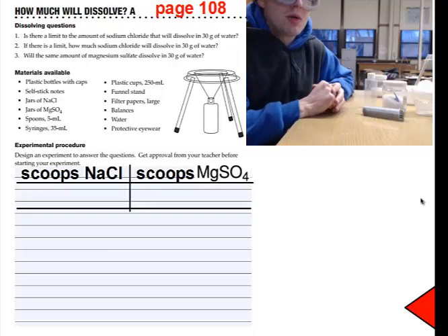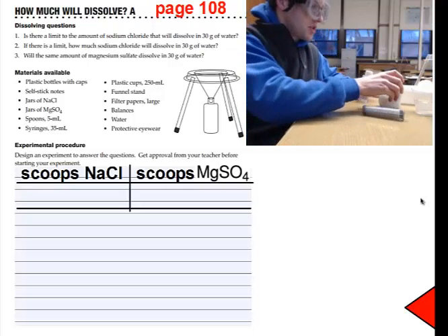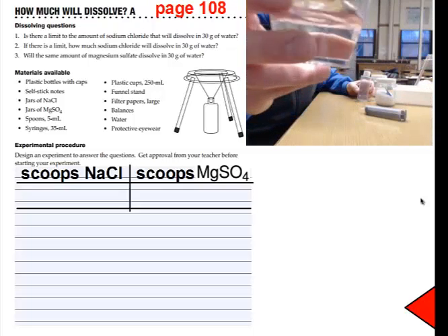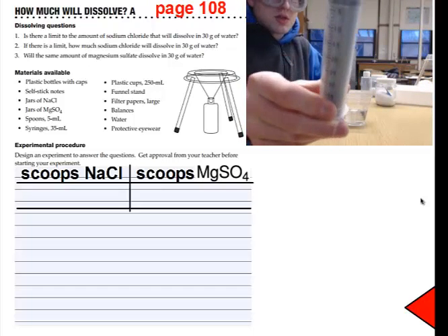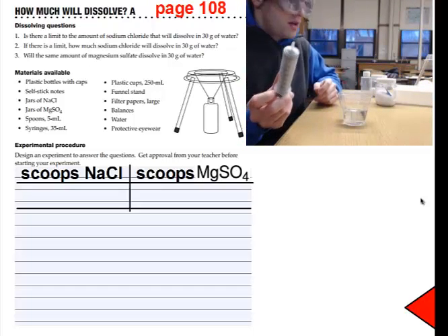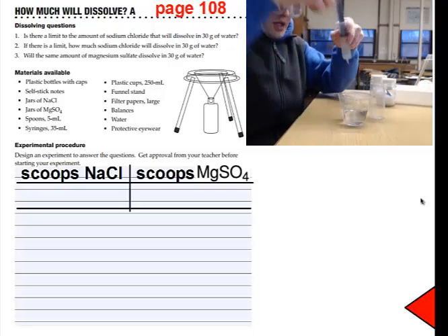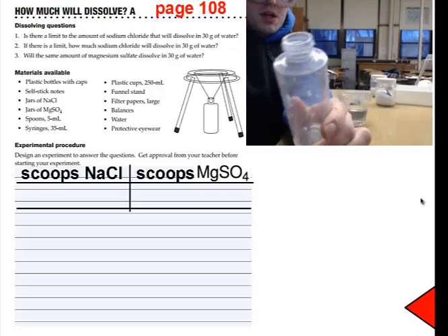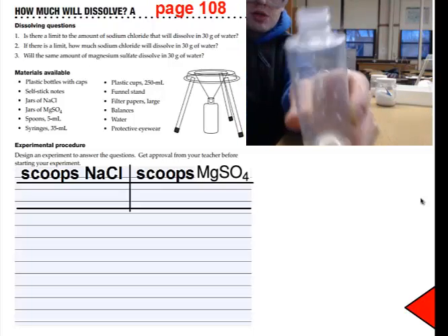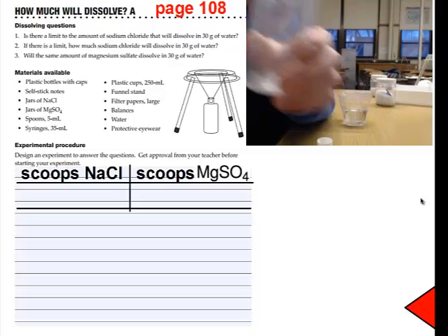First, you're going to want to open your notebook to page 108, and the first thing you're going to do is get a cup of water, and then using the syringe, you're going to get 30 milliliters of water in the syringe, and get one of these bottles with a white cap. Take off the top and put exactly 30 milliliters of water into the bottle.